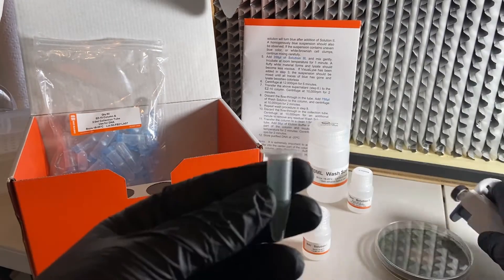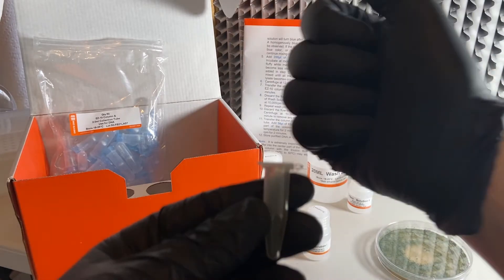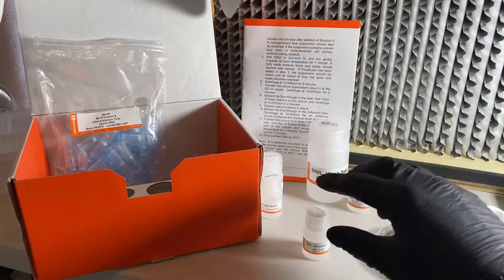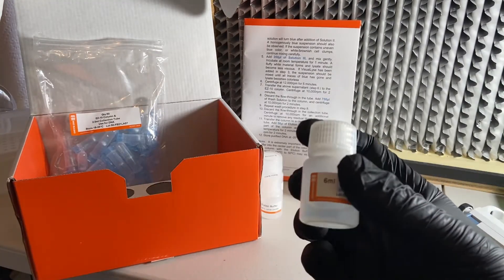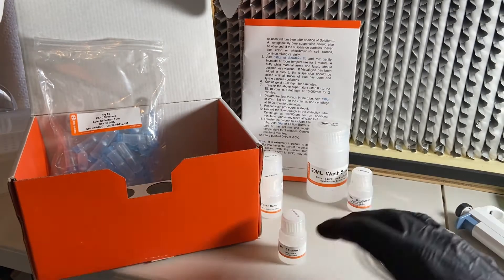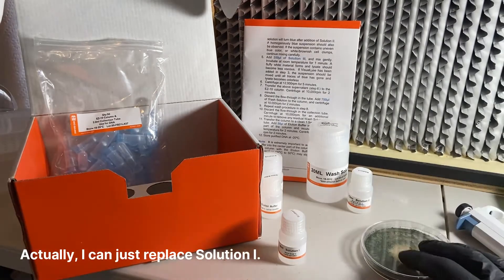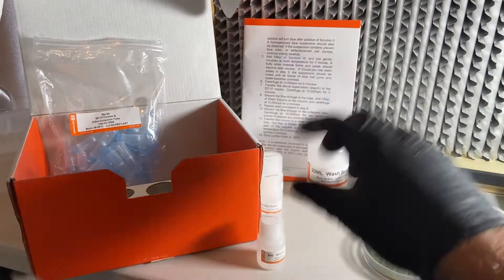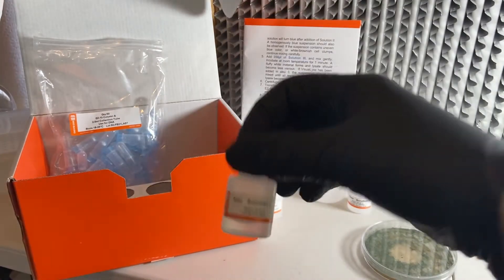When I went to do that, as soon as I pushed the liquid down, the spores rejected it and they flew everywhere — all over my kit. With the lid being open, a bunch flew inside. That basically means this kit is ruined, because solution one is the first solution that goes in the kit, and everything downstream could potentially be contaminated by conidia from these spores.